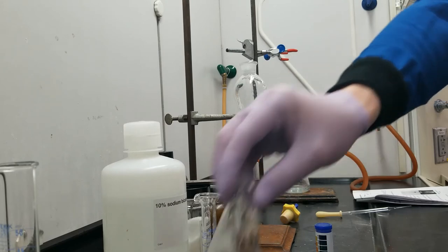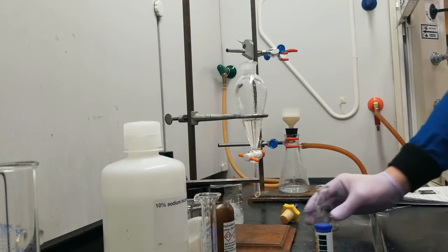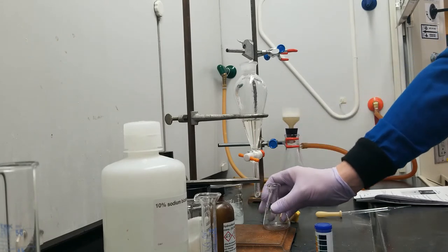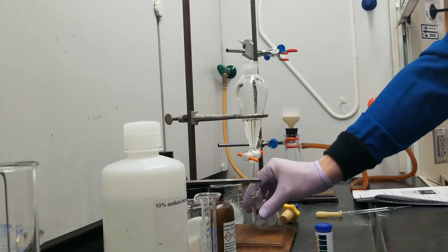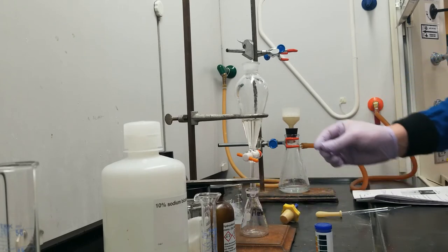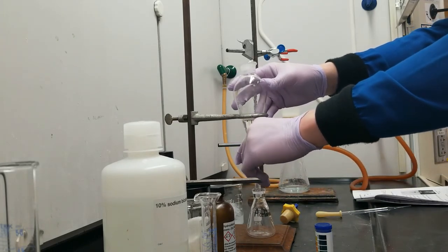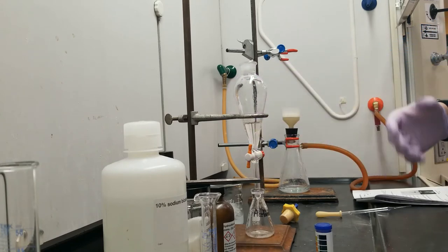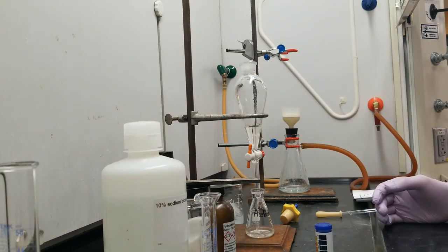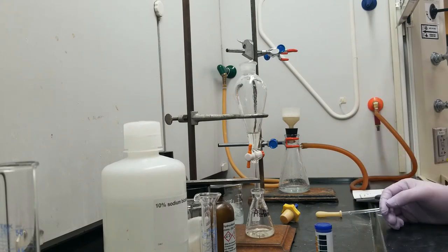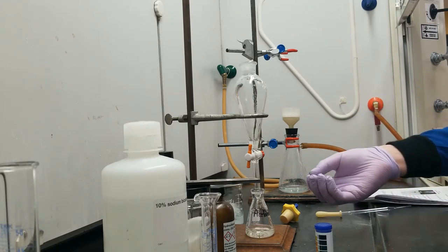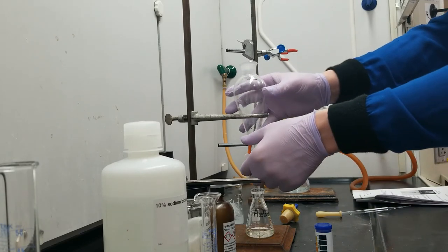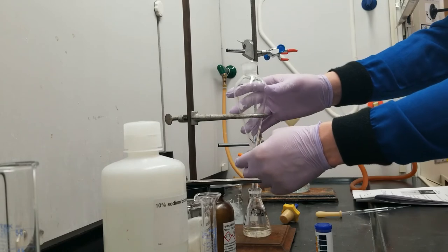I've got a collection flask for my acetanilide diethyl ether layer. And let's go ahead and collect that. Now whenever you shake your organic solvent with an aqueous solution, you are going to get trace amounts of water in your organic layer, which are going to mess up your rotavapping stage and you'll never get a nice dry product. So we're using sodium sulfate again.